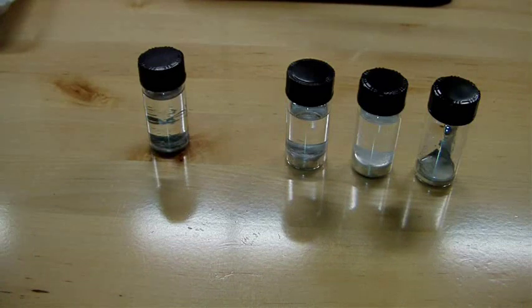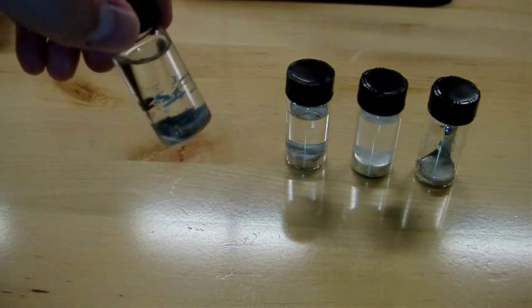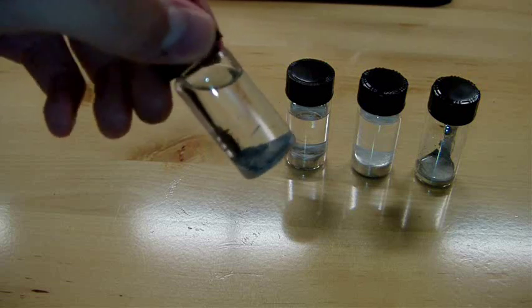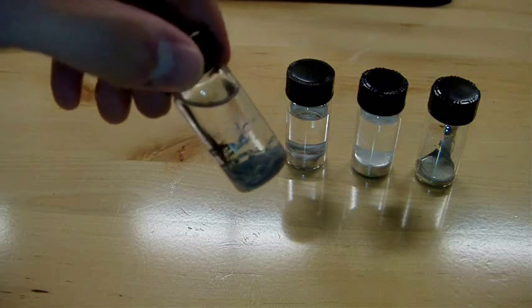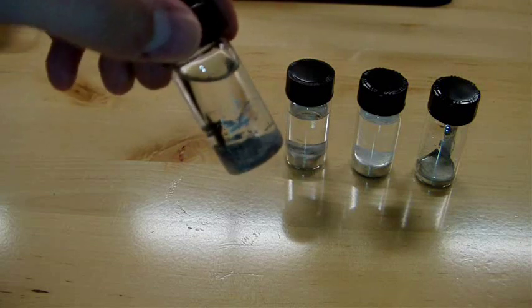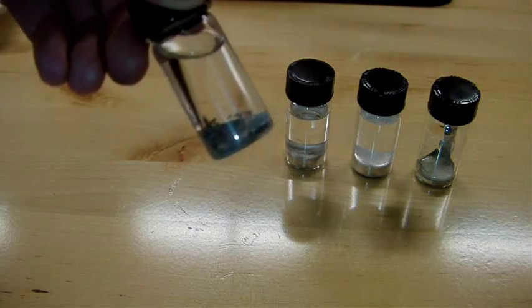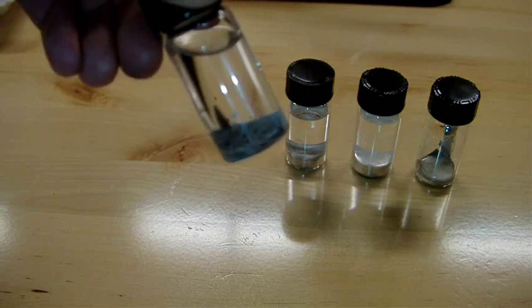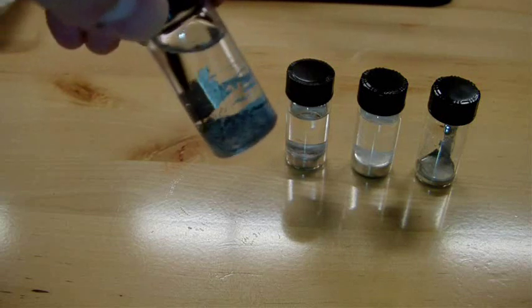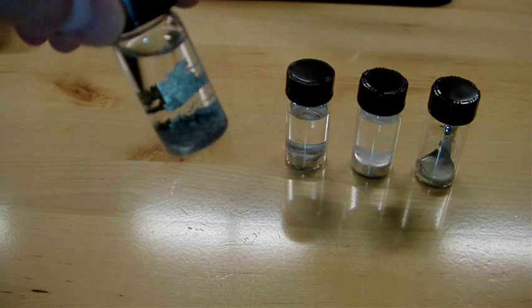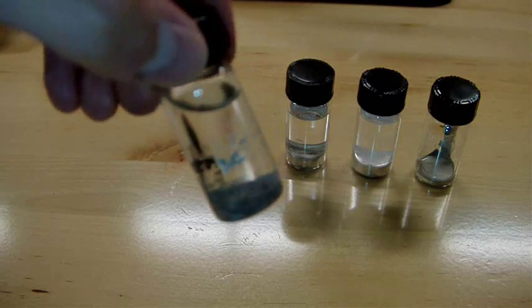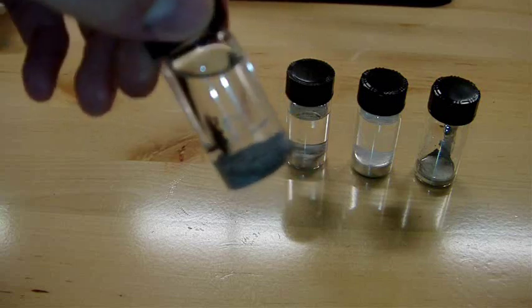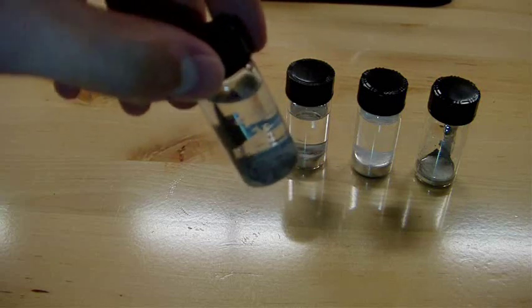By the way, just for comparison, here's the metal that I made from the low purity stuff. And you can see it looks quite a bit worse than the others. It's a lot darker, sort of a more dull gray color. It's a lot more, you can see a lot more solid in there. So I imagine that's all the impurities that don't amalgamate together, and so they stay solid while the rest of it is a liquid. And I had it in air for a little while before I put it in. It's under oil right now.